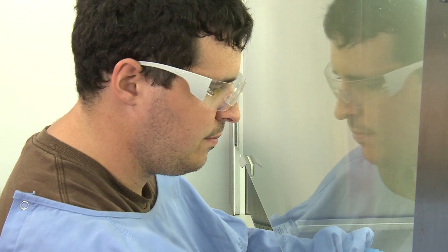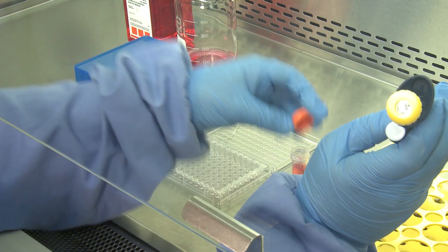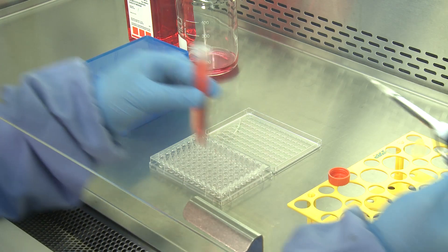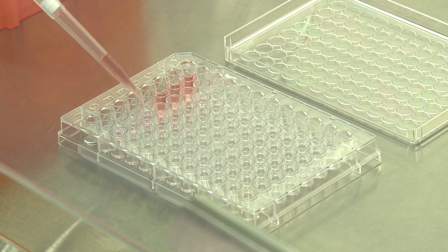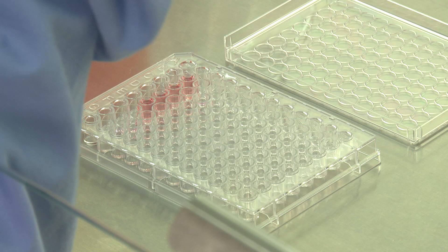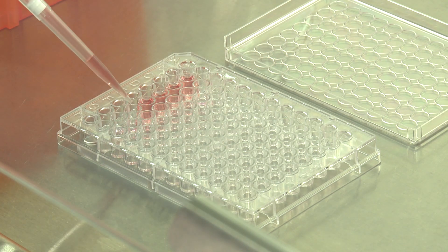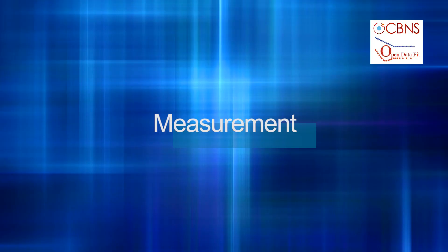Prepare your treatments by making up the most concentrated sample and serially diluting the sample. UV sterilization and sonication may be required. Remove media and add each treatment to the appropriate well. Leave the plate in an incubator for 24 hours.